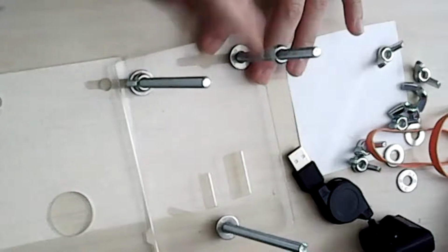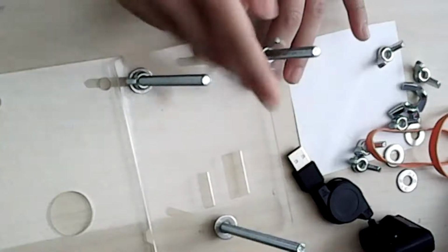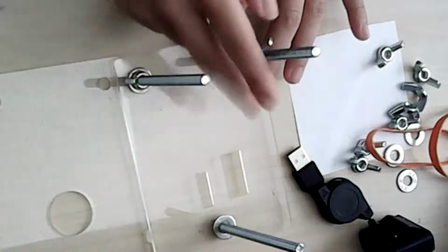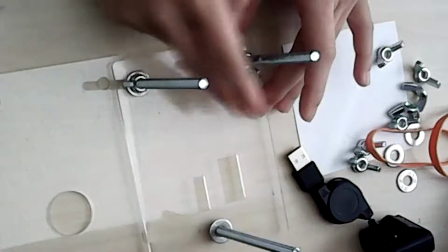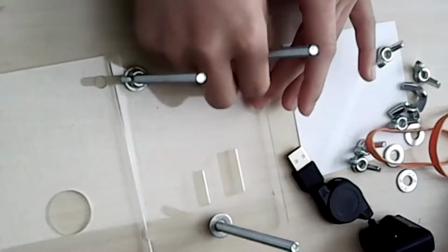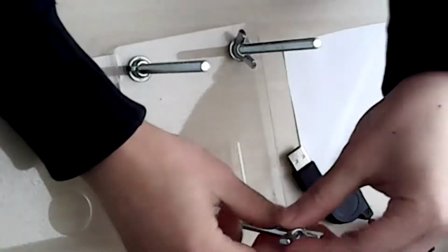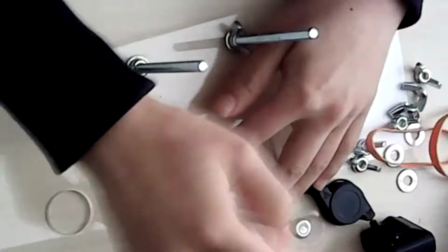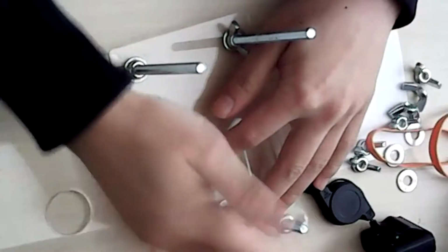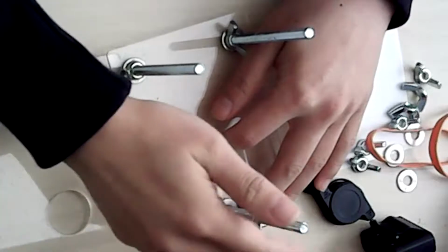And this dissecting one is much better for 3D specimens, where it's a little bit larger and too thick for the light to pass through. So you do end up creating the light microscope configuration, just be aware not to put things that are too thick, otherwise you won't be able to see anything. For this configuration, you can put things that are not see-through.